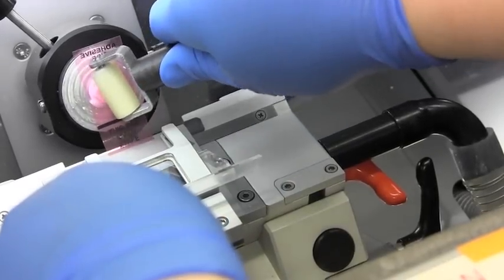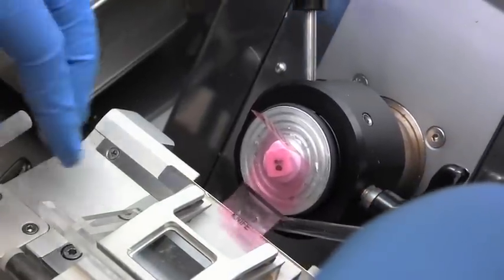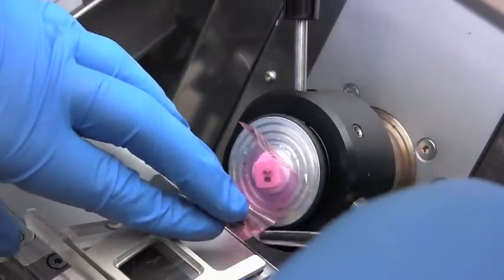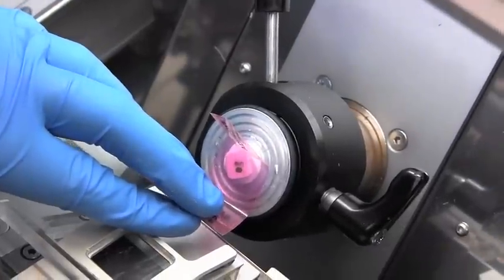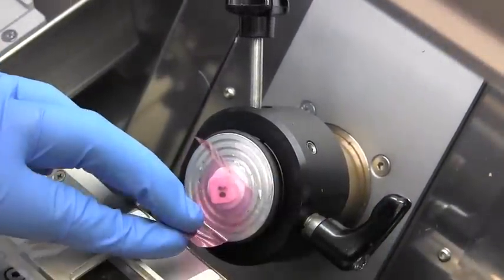Roll the tape on. To protect your fingers, use the end of a brush to pick up the end of the tape, so you don't put your fingers anywhere near the blade — it's very sharp. You don't know you've cut yourself until it's too late usually.